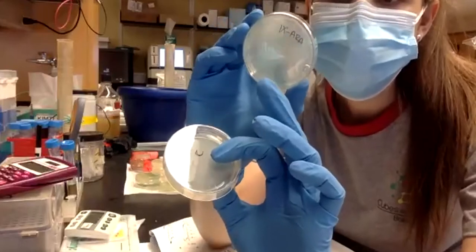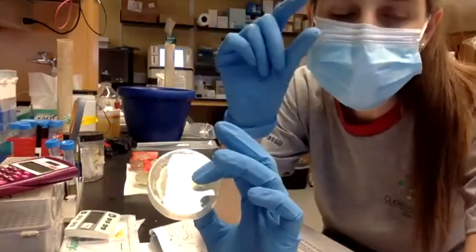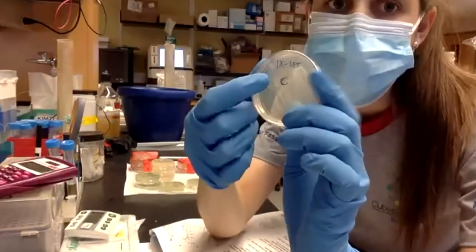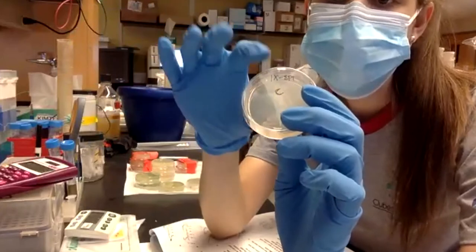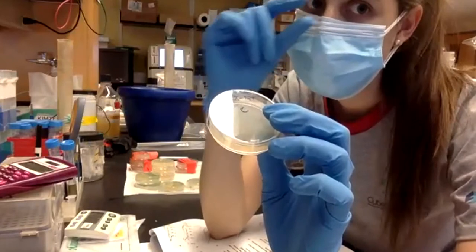We will transform them in the tube, and when we have everything in the tube, the CRISPR reaction will happen in the tube. And then we will put everything here. So there will be no need to select for the arabinose anymore, because the homology repair reaction will happen in the tube very fast.